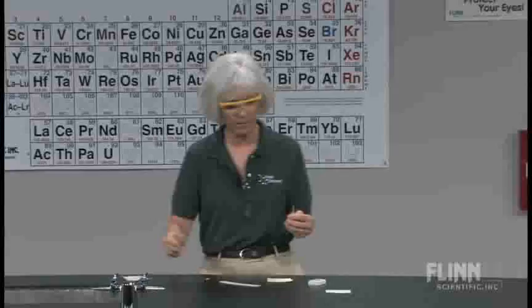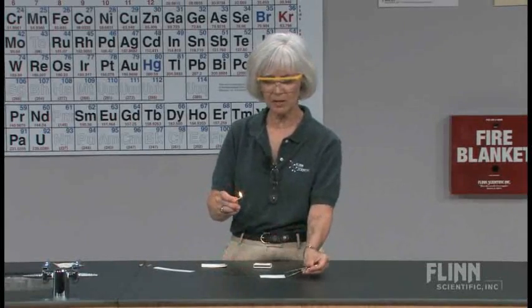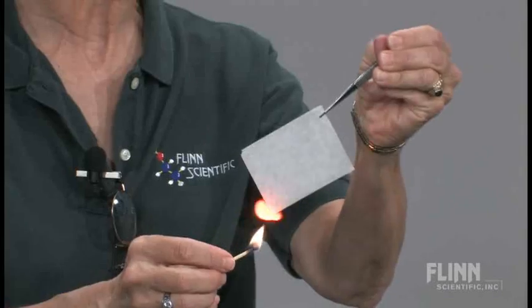Of course, we'll go put this into the sink into some water. Then I'll say, let's take another piece of paper that looks a little bit different and repeat the experiment. Both combustions each involve reaction with oxygen, but obviously at a different rate. What determines that difference in rate? It's the nature of the reactant — the nature of what you burn. For teacher information: why does that flash paper burn cleanly and so rapidly? If we need oxygen for something to react, that oxygen is furnished by the air. But it turns out the paper has been treated — it has been nitrated — and therefore within the paper there's actually more oxygen than in regular paper. So once it burns, it has that other oxygen from the paper's chemicals to help the combustion, and we get that clean combustion.